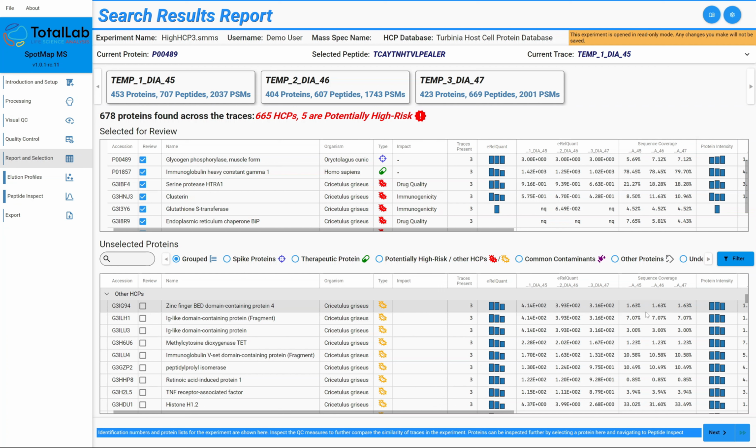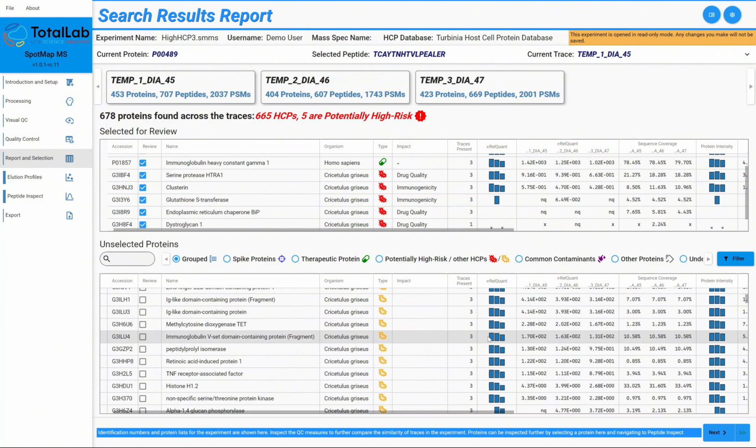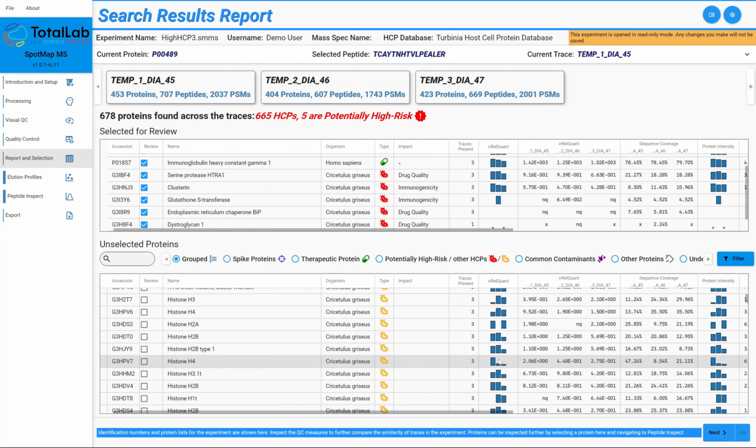Now, a lot of the feedback we were getting from people was that because it's so difficult to distinguish these very low levels of host cell proteins versus your typical background noise, they would only accept a true positive if the host cell protein was present in at least 2 out of 3 of the traces of their triplicate run sample. So we wanted to build that into the software to be able to cope with that workflow. So our initial attempt was obviously to have our eRel quant shown visually in these columns. So you can quickly see where the host cell protein has been detected as present.